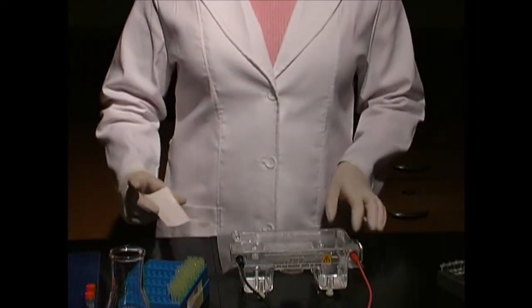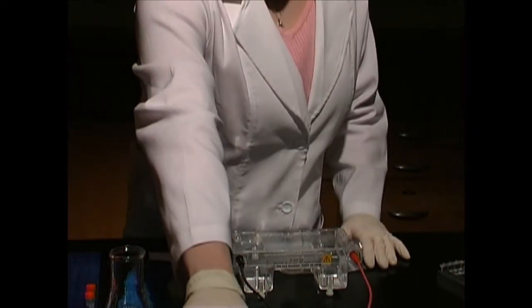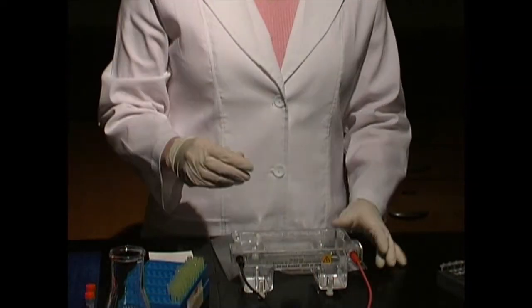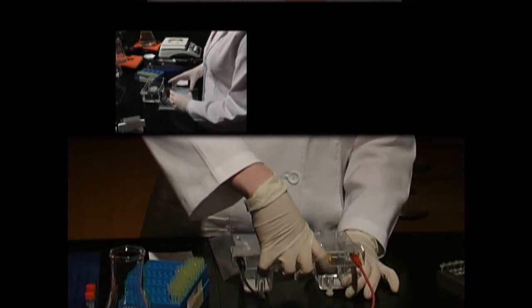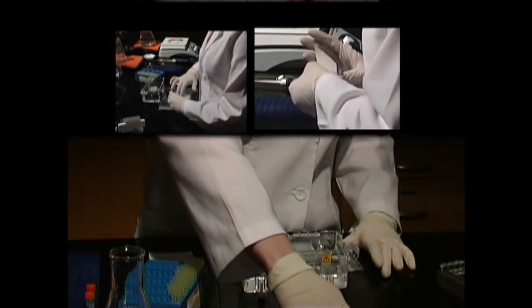Once the electrophoresis is done, turn off the power, unplug the electrodes, and remove the cover. To make the isolation more apparent, stain the gel for transillumination.